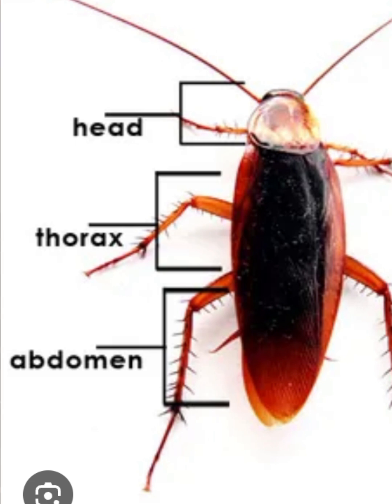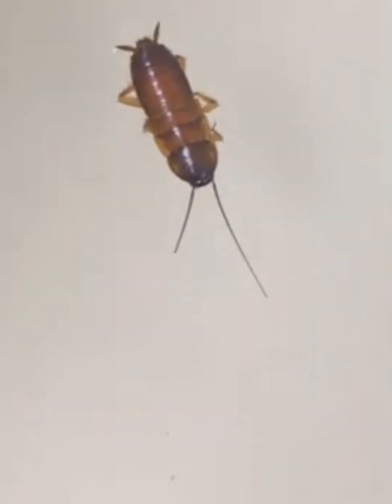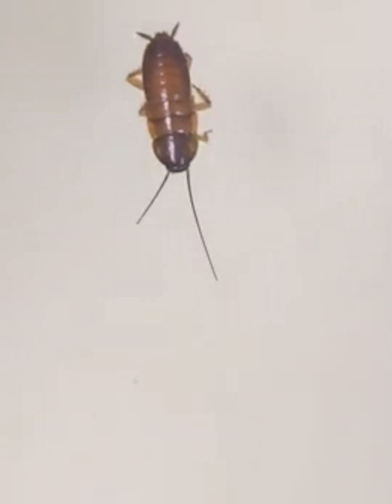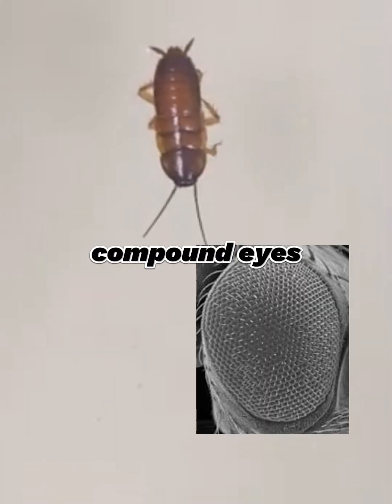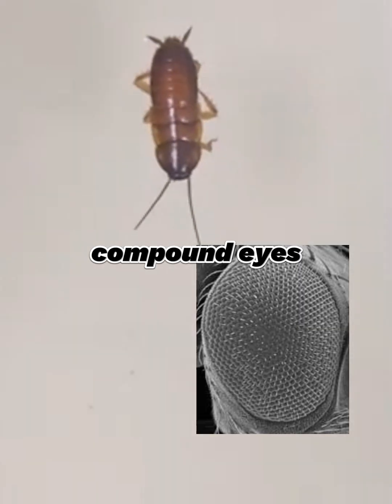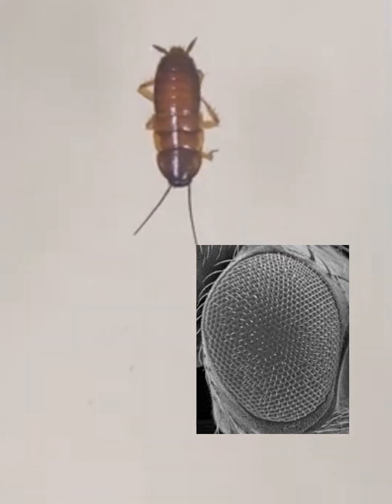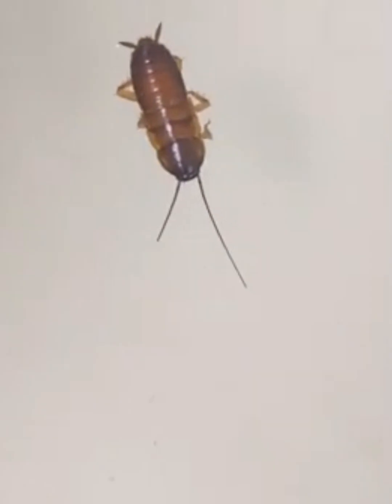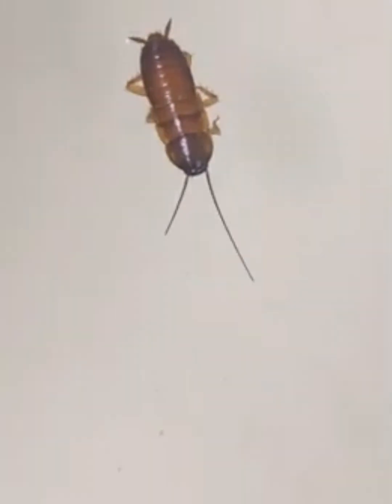The head has a pair of long antennae which act as sensory organs. They help the cockroach to detect smell, touch, vibration and any kind of change in its surrounding environment. And in the head, on both sides are large compound eyes, and these eyes are made up of numerous tiny visual units, you can say many lenses, and the purpose of these is to help the cockroach to visually detect movement and provide a wide field of vision.